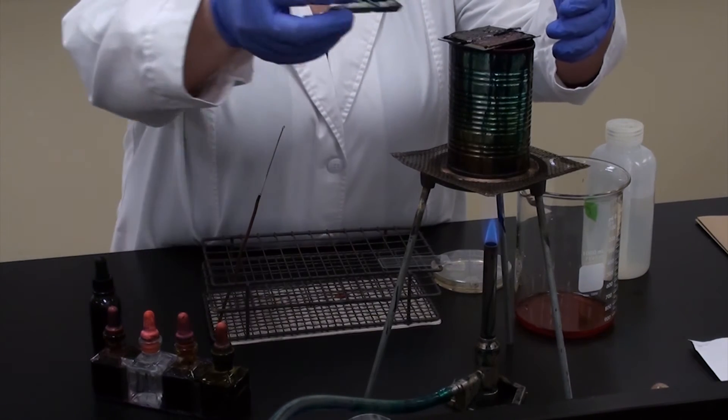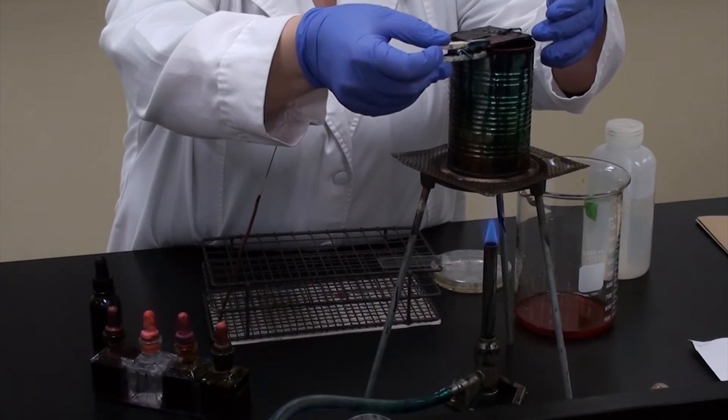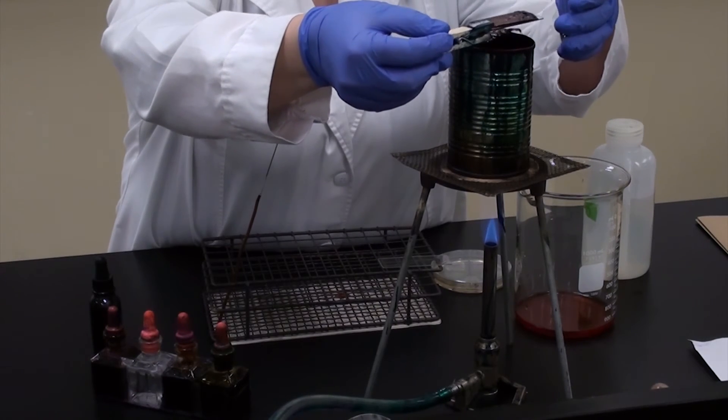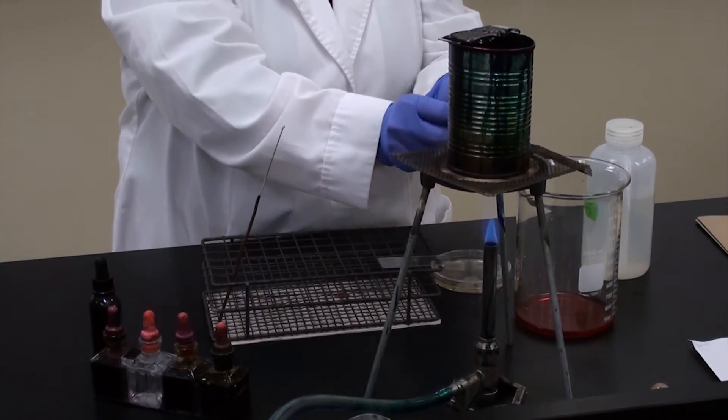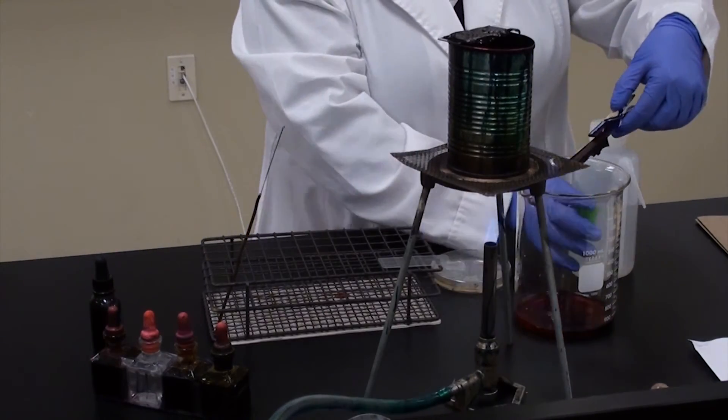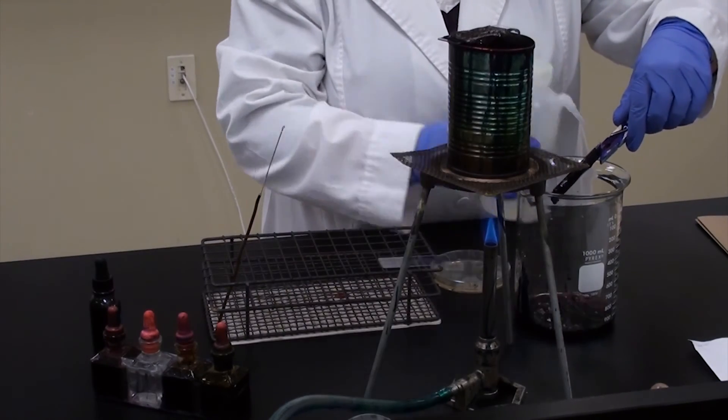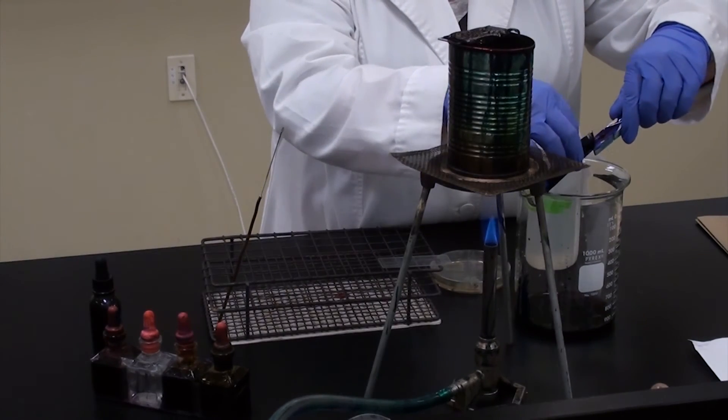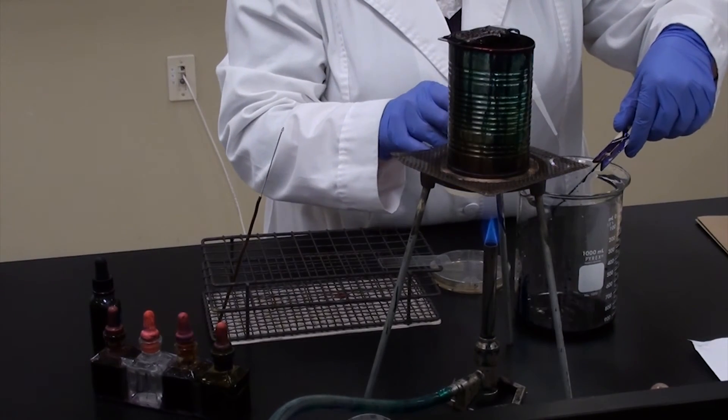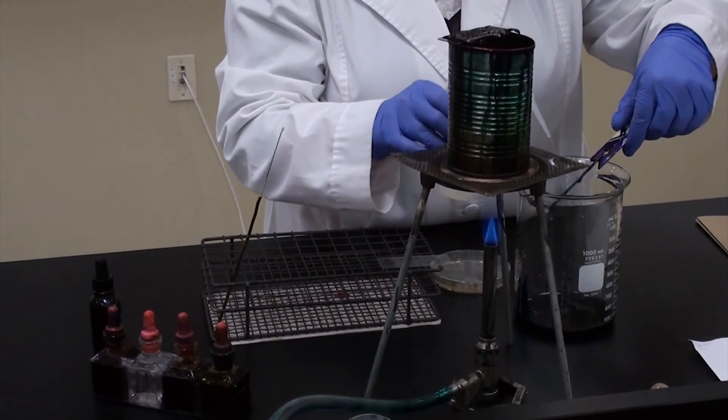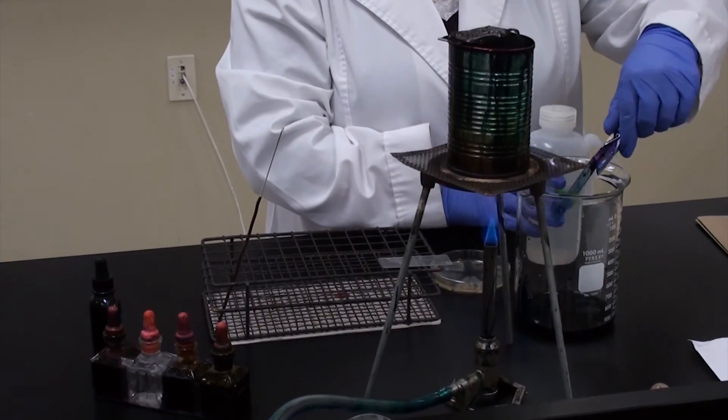Now this slide I've been steaming for about 10 minutes, so I'm going to remove it, carefully using my super exotic microbiology tool, and I'm going to gently rinse the slide and the bibulous paper off.